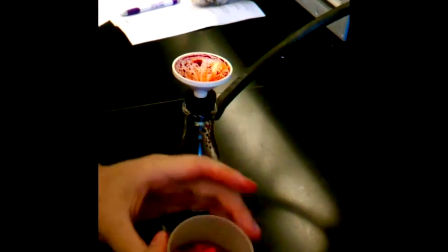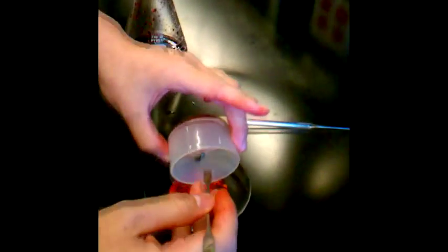After 5 minutes, remove the filter paper from the funnel using the double-sided spatula. If there are some crystals on the outer edges, you can use the spatula to scrape as much of the crystals out onto the filter paper.